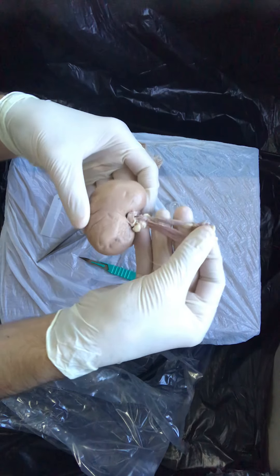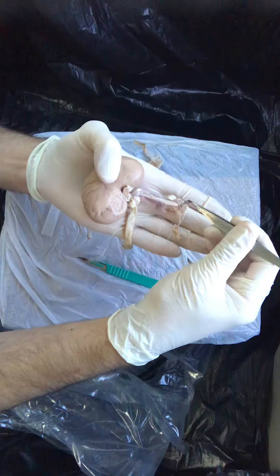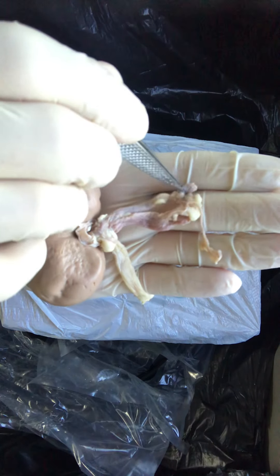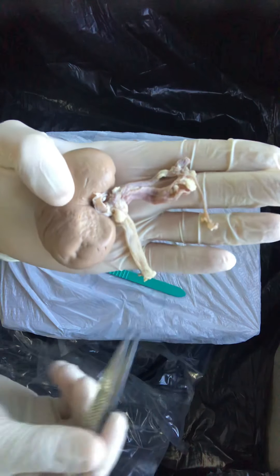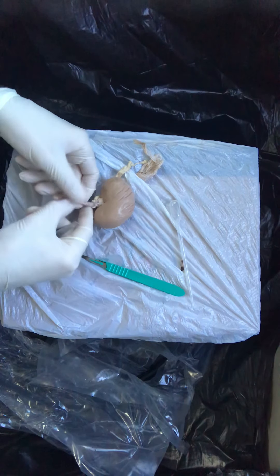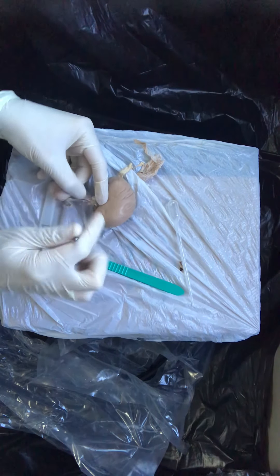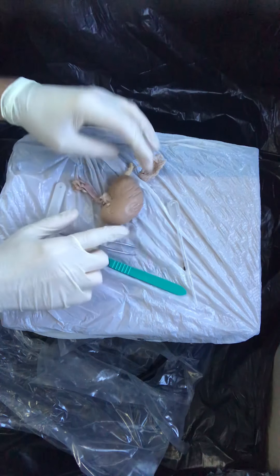So what you're seeing superiorly here — this most superior structure — there's the artery superiorly, the vein here, and then the ureter coming off as well. You can separate those structures as much as you want to as you're going toward the kidney, with your scissors or your pickups or your scalpel — you can really tease them apart. And if you wanted to, you could follow it clear all the way into the hilum of the organ.